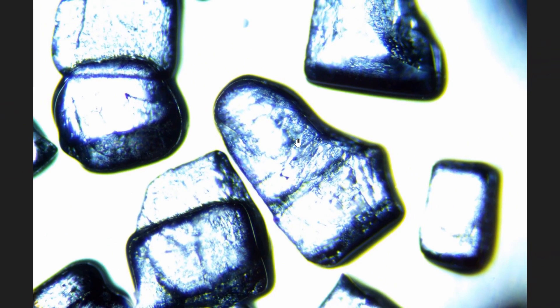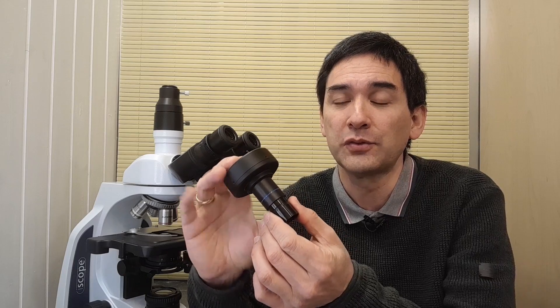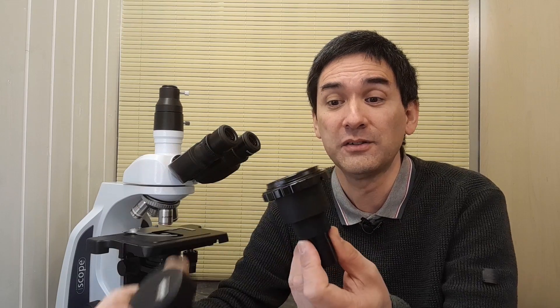This image was taken with my USB microscope camera, and the intermediate optics of the adapter essentially caused quite a bit of this discoloration. So why is the chromatic aberration so bad? Because the chromatic aberration is actually not from the microscope objective — maybe a little bit — but look at this adapter here: this adapter destroys the image quality quite a bit. This leads to an important point: there is no point in investing a lot of money in very expensive objectives if the adapter or DSLR adapter destroys the image quality anyway. You have to look at the whole system and how the parts work together.